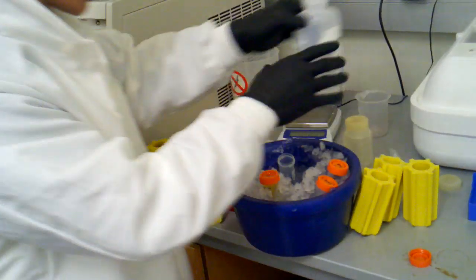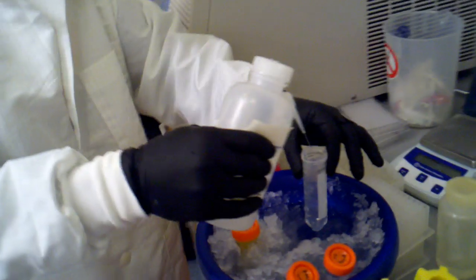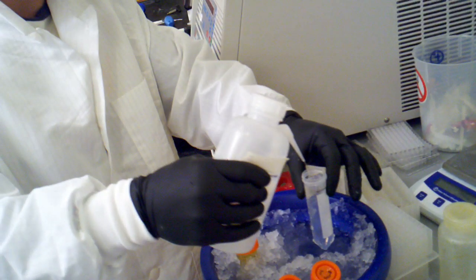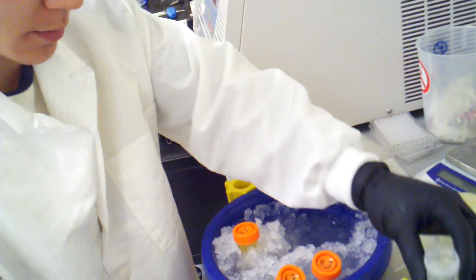There we go. You can see that. So I'm just going to try to get it as close as possible. And put this in one of those holding tubes.